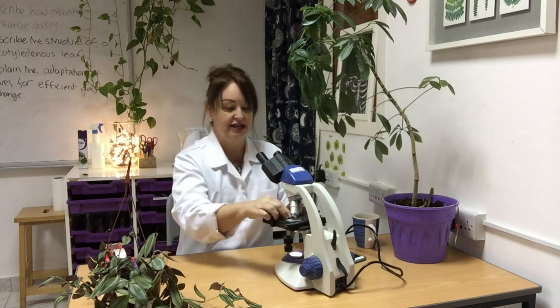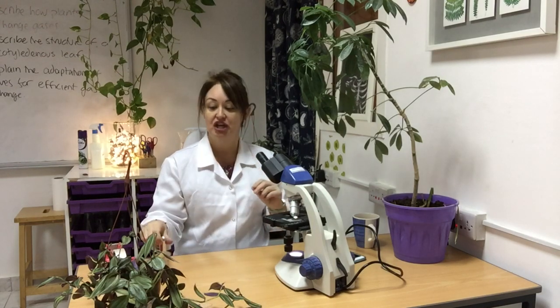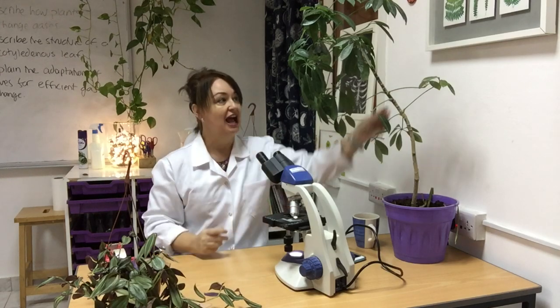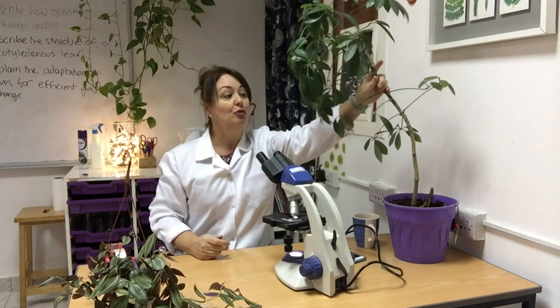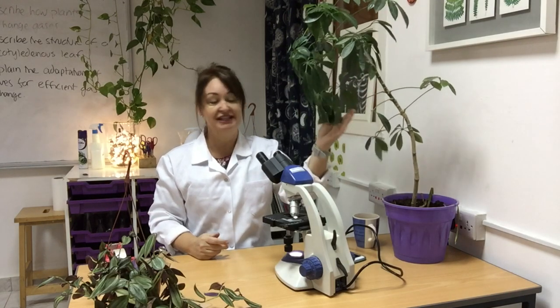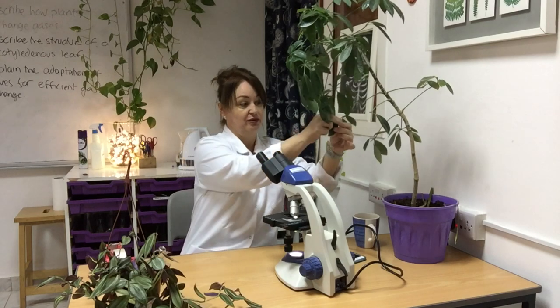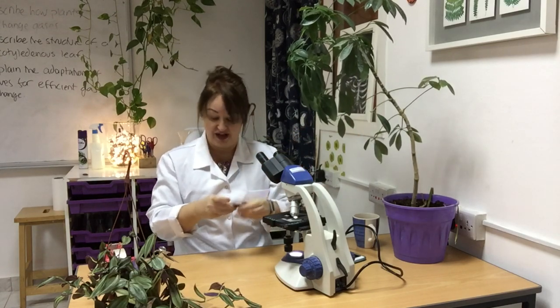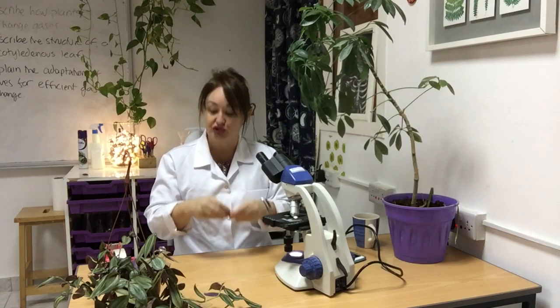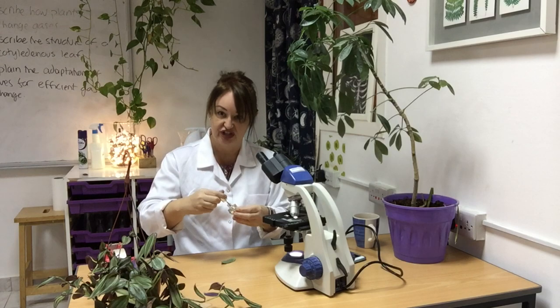The other way we can do this is by taking an imprint of the leaf using nail varnish. I've tried lots of different leaves, and this type of plant — I think it's a ficus, you'll have seen it as a house plant — produces the best results. Take a leaf; you don't even need to remove it from the plant. Make sure it's dust free.